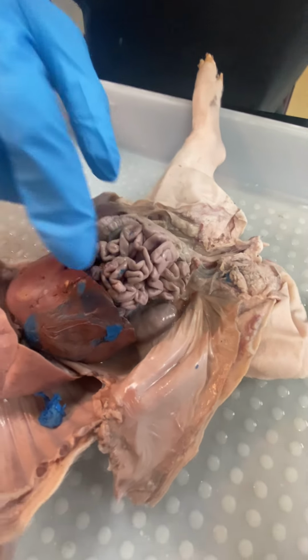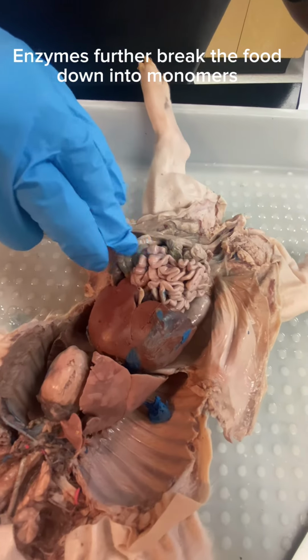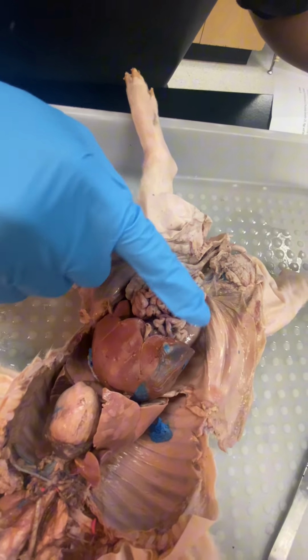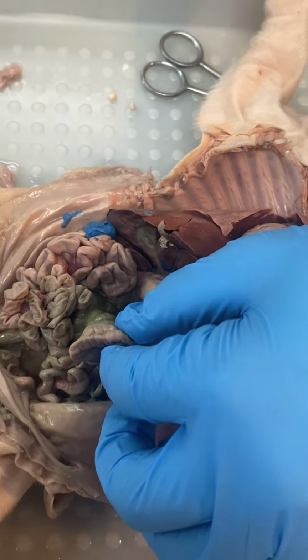And then it passes through the small intestine, where it's further broken down and absorbed by the villi on the intestinal wall. And finally, the indigestibles go through the large intestine. All this green stuff is the large intestine.